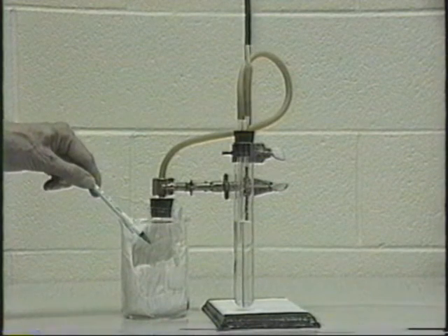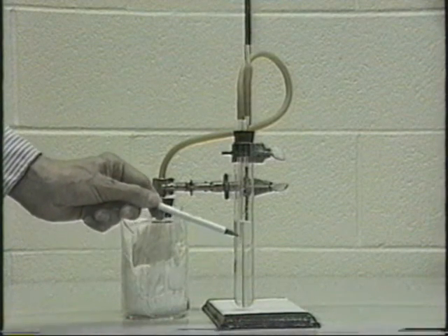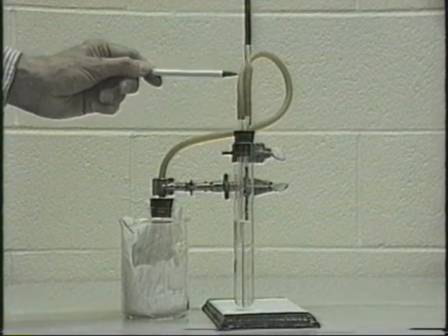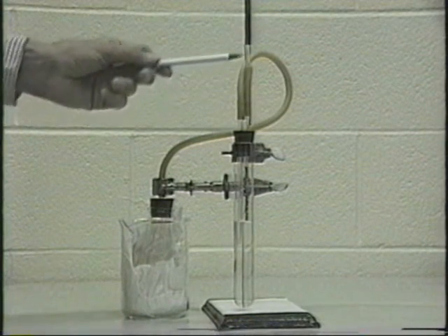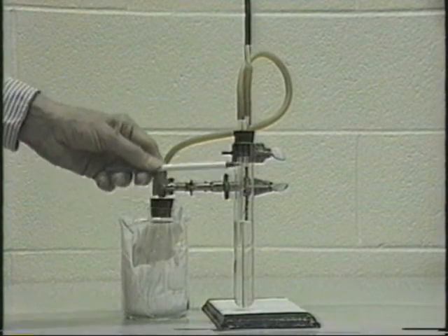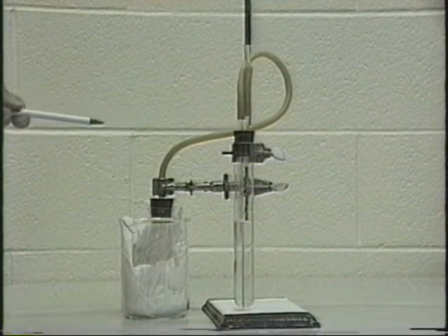The dry ice will slowly sublime, giving off CO2 gas. The CO2 gas will pass down and bubble in through the solution and then out through the Bunsen valve here. Now, the Bunsen valve has a small slit in it to let out the CO2. That slit must be pointing away from you in some direction where it's not going to be pointing at anybody, because in case some of the solution should, for some reason or another, bubble up and spurt out there, you don't want that to go into anybody's face.